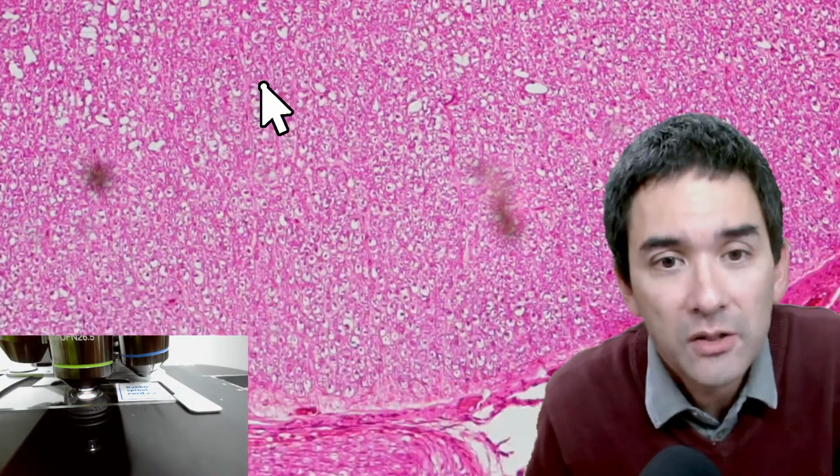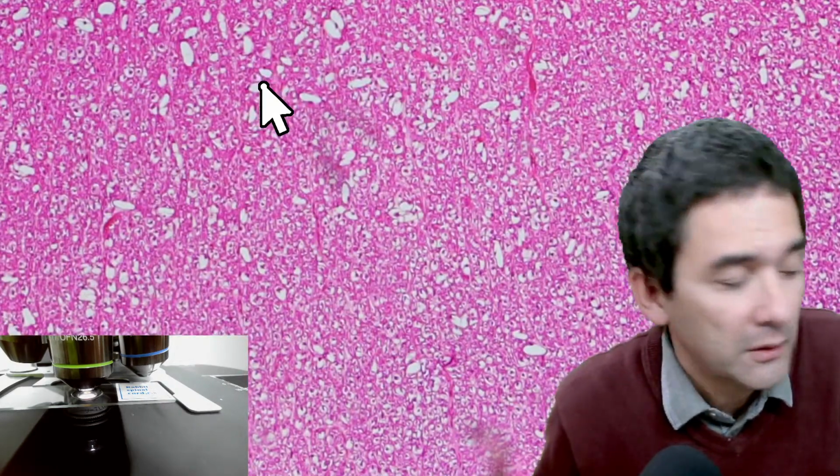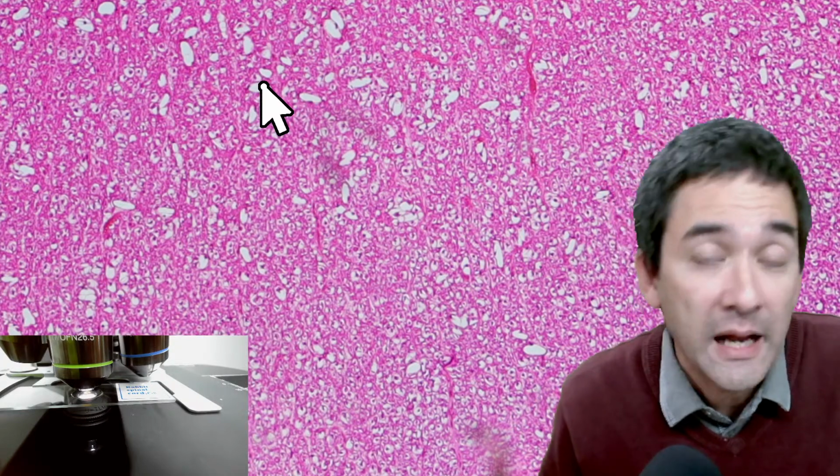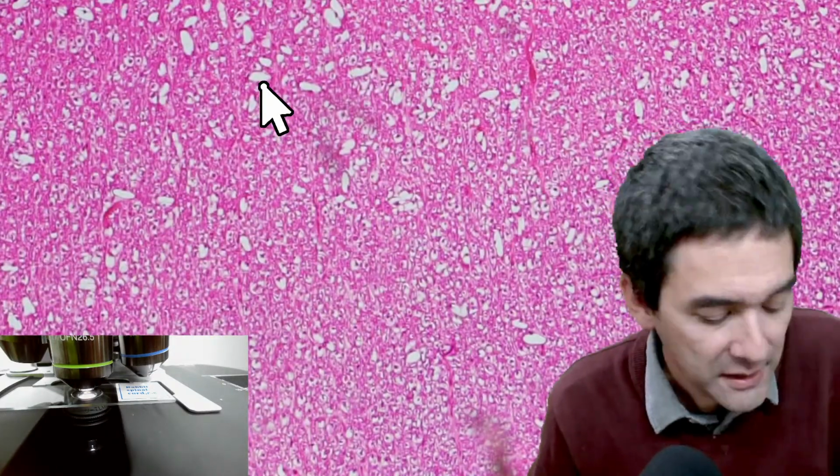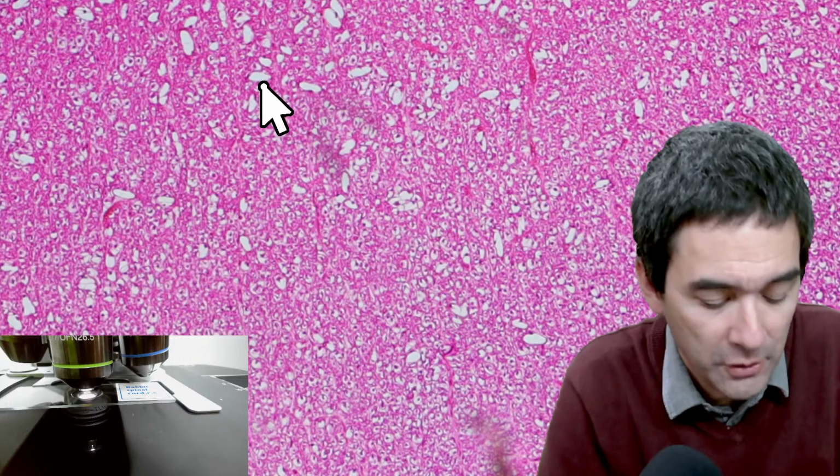That's the way I would do it. Of course I would not only rely on one slide, but on several, and then calculate an average. And if the blood vessels run vertically, then the result might even be quite reliable. In this case you do need the micrometer slide that I showed you before.